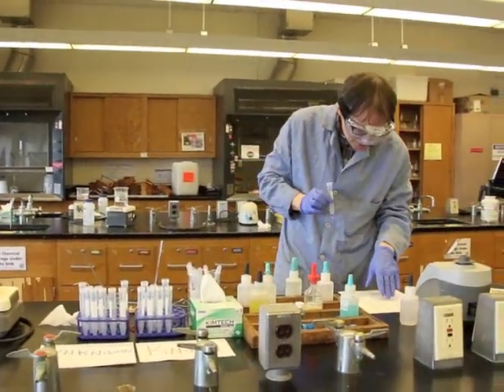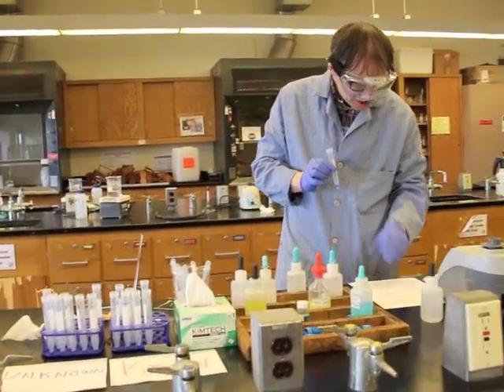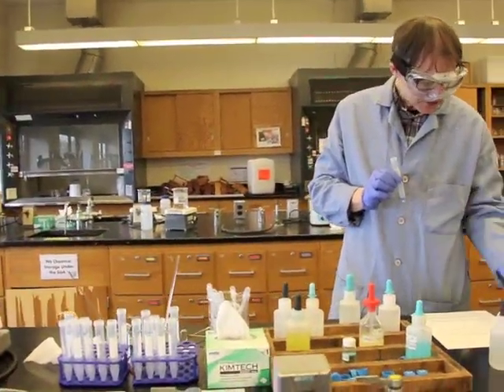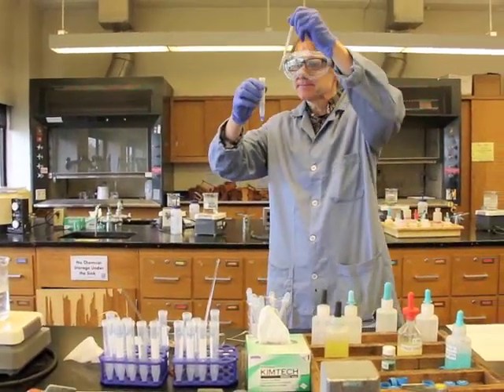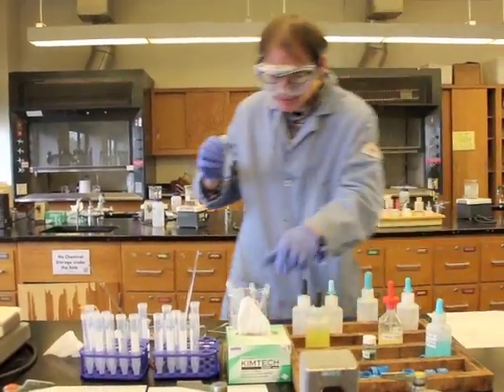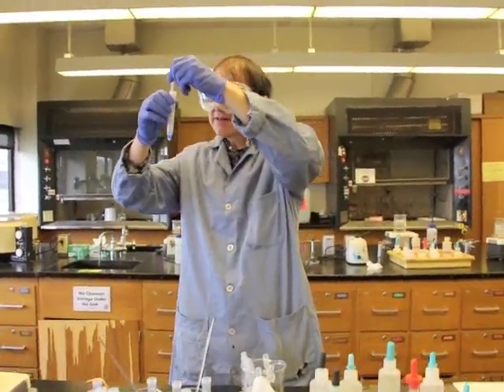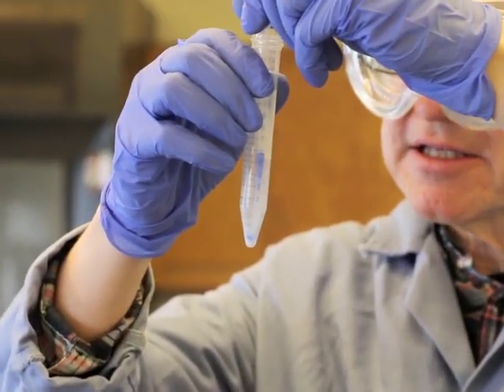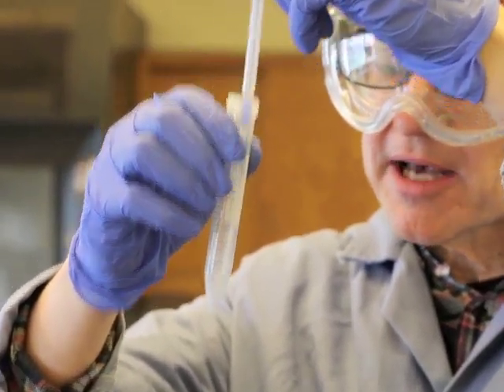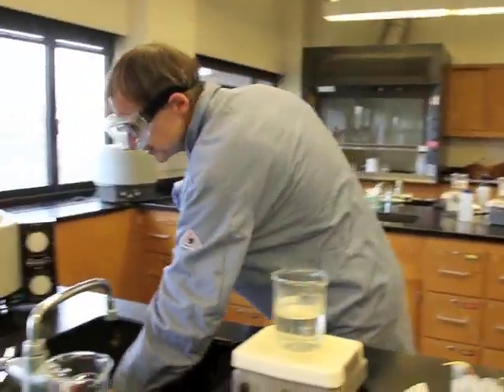Moving on to the next step, what it says is you're going to add 20 drops of distilled water to the precipitate and stir. So what I'm going to do before I actually do that is getting a clean one. I'm going to come over here and I'm going to go ahead and suck off some of that liquid just to make sure that this precipitate is not contaminated by that liquid. Okay? And then I'm going to go ahead and put this aside.